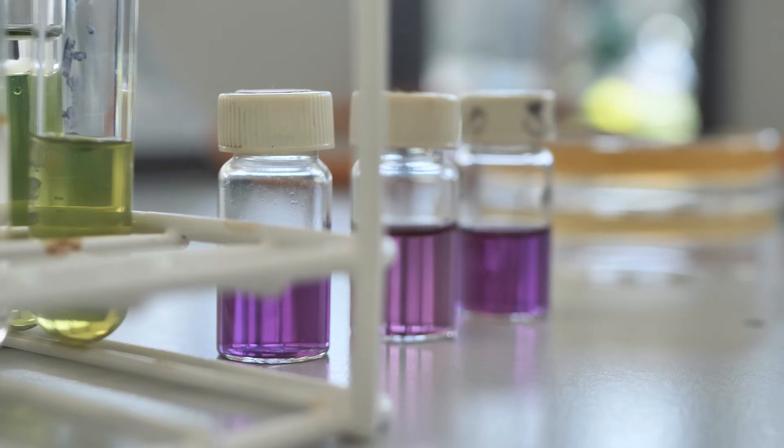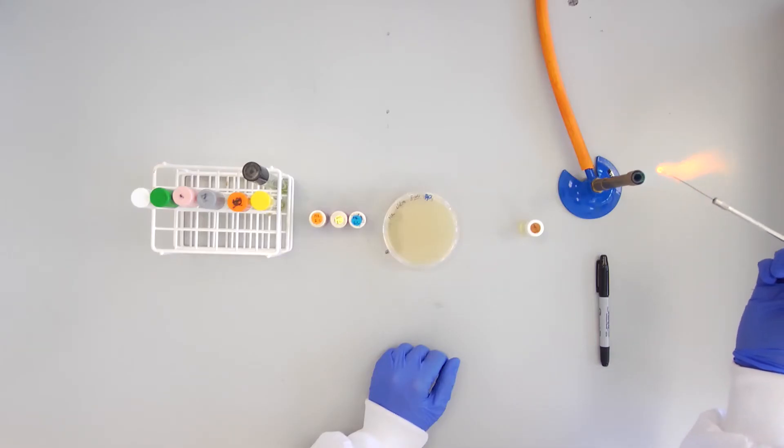For the amino acid decarboxylase tests, add a loopful of culture to each of the three bijoux containing purple liquid.